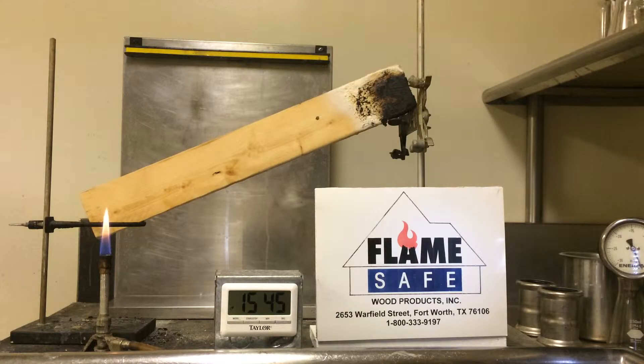The specimen being burned is the same as that which was burned previously in part one. We reversed edges. This test is going to be conducted on the specimen mounted edgewise.